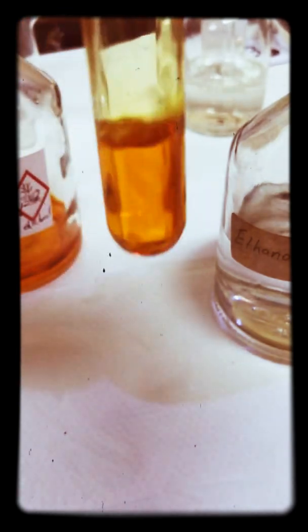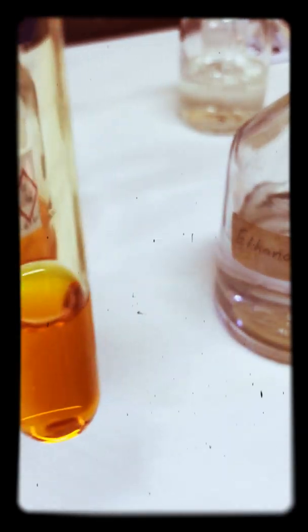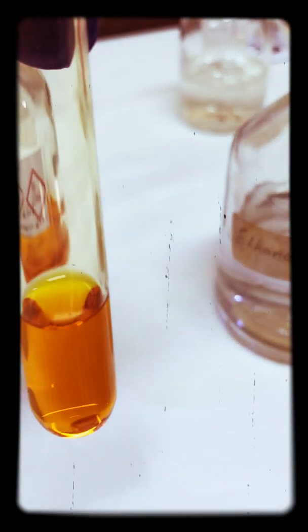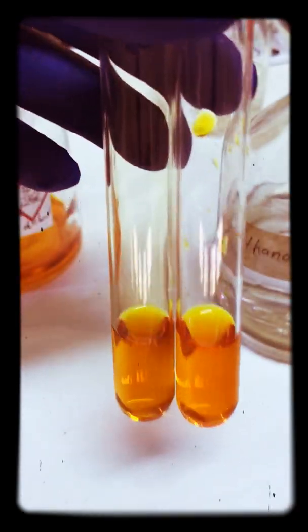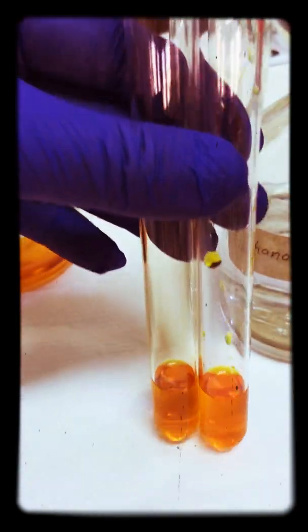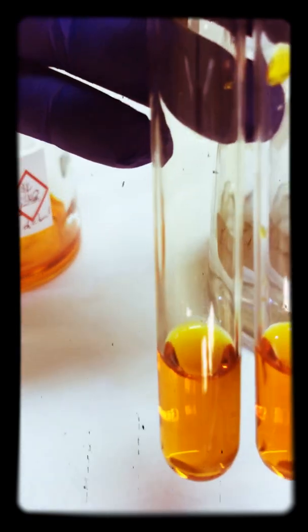Now this is the original, so you can perhaps see a slight color change even immediately on the left hand side. If you're not convinced with that, then after ten minutes it will look like this.